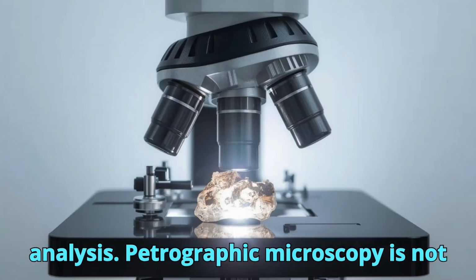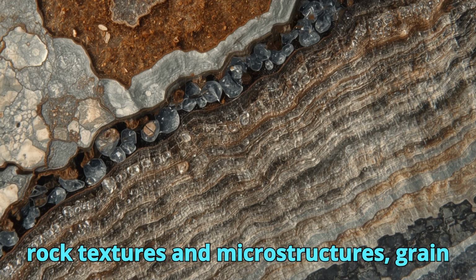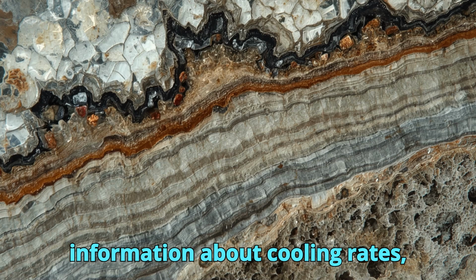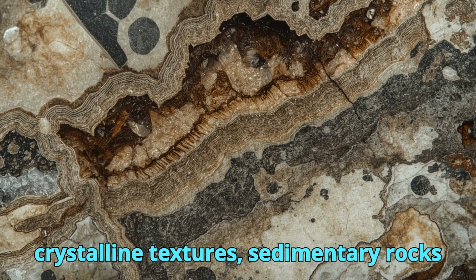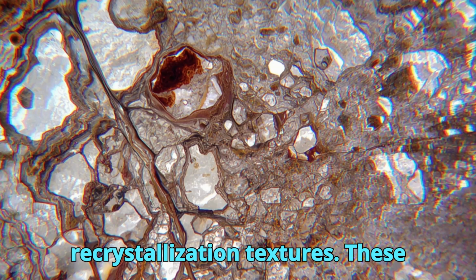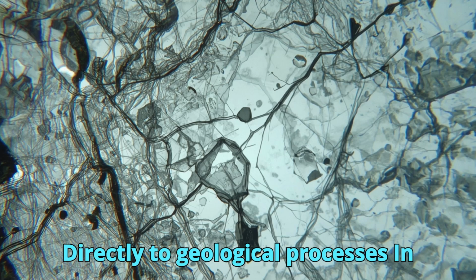Petrographic microscopy is not limited to identifying individual minerals. It also provides insight into rock textures and microstructures. Grain size, grain shape, crystal boundaries, and mineral relationships reveal information about cooling rates, deformation, and metamorphic conditions. Igneous rocks may display interlocking crystalline textures, sedimentary rocks preserve cementation and depositional features, and metamorphic rocks exhibit foliation, lineation, and recrystallization textures. These observations link microscopic features directly to geological processes.